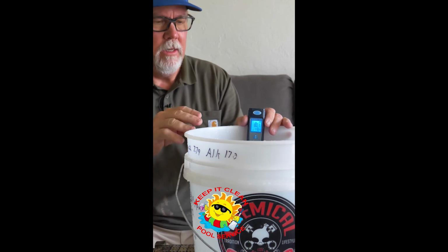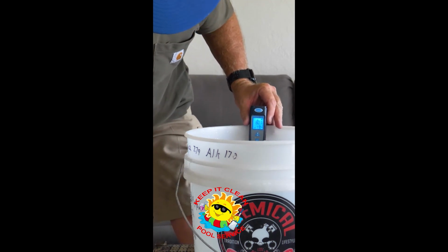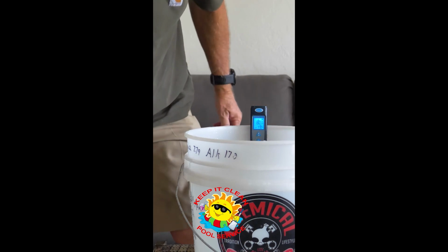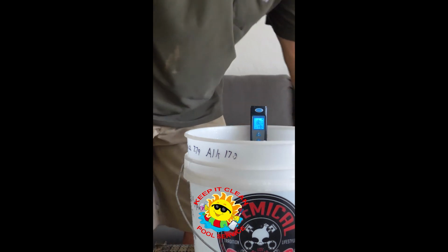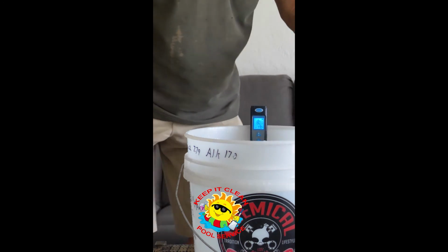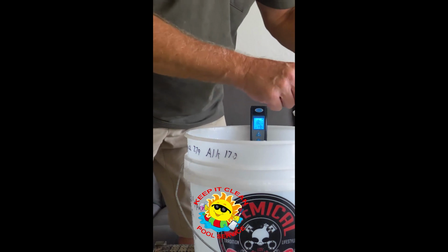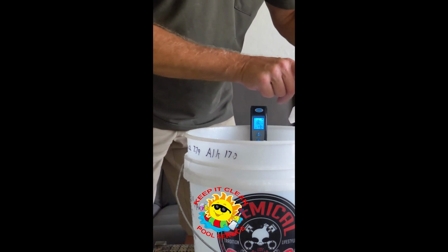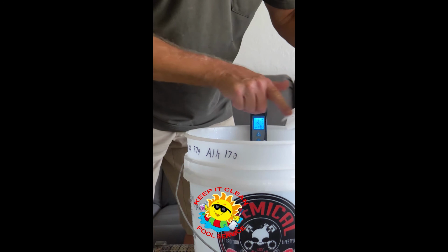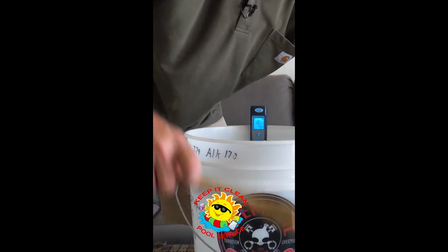All right, guys, I'm back here. Now let's check it out. I just got done aerating it back up again, and I'm going to get ready to add in the conditioner. We got an 8.01, okay? And again, I'm not going to add in all of this conditioner right here because it's probably going to be entirely too much. We'll add in maybe about a half of that. I ground it down pretty fine so it goes in pretty much right away.